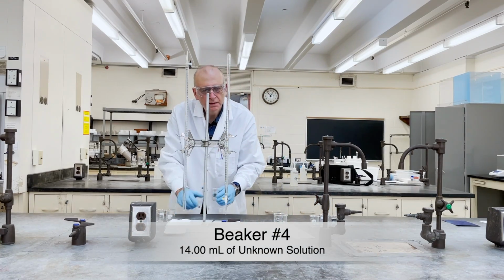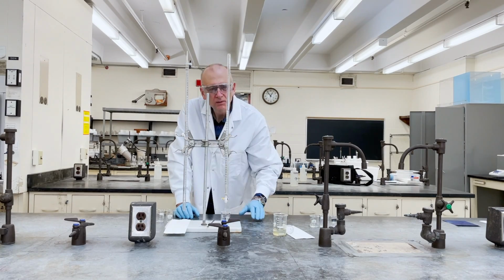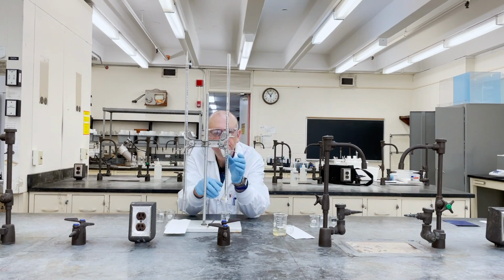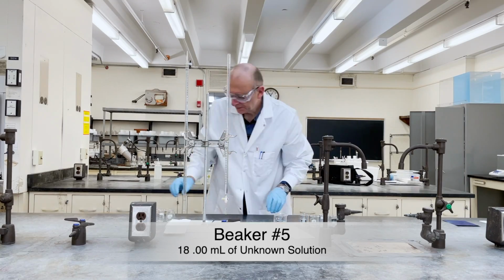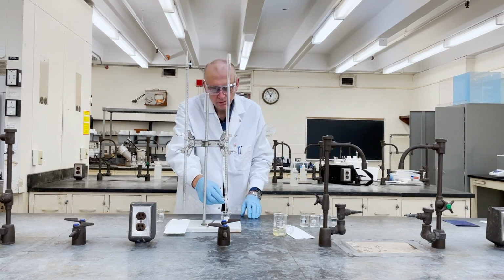Then 14 milliliters into beaker number 4. Refill the burettes before dispensing 18 milliliters and 22 milliliters into beaker number 5 and 6, respectively.